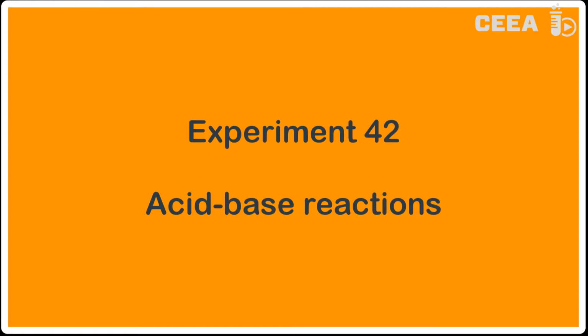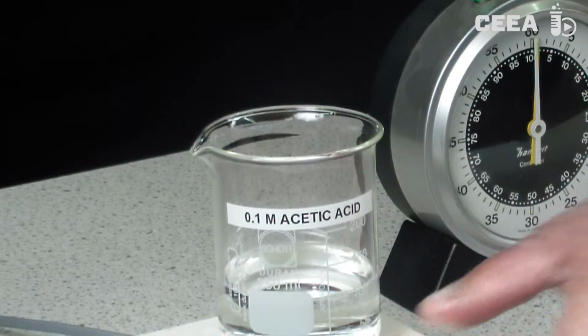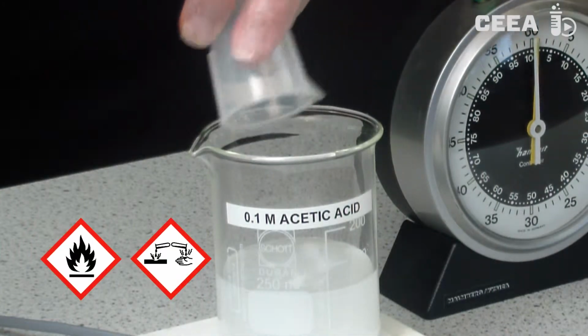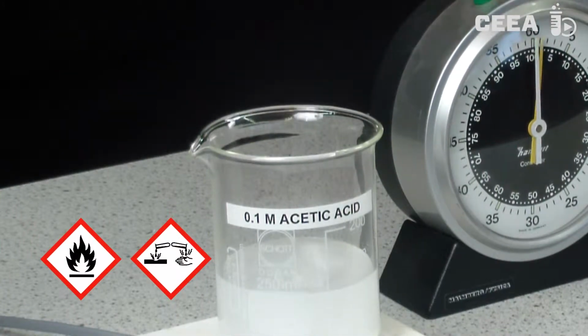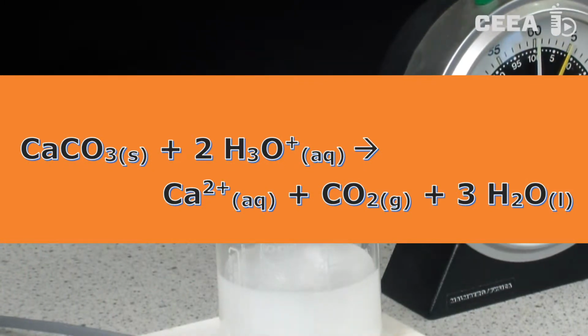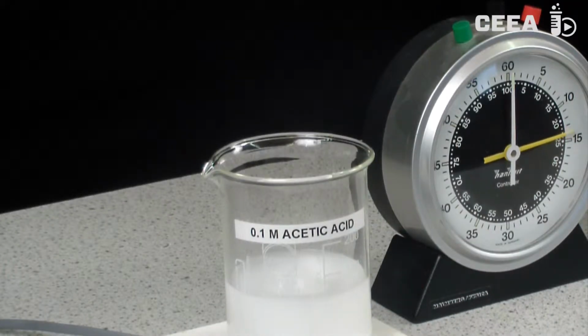Experiment 42, acid-base reactions. In this video we show an example of an acid-base reaction. We add calcium carbonate to an acidic solution and we see a reaction according to the chemical reaction shown here. The result of adding solid calcium carbonate to an acid is that the calcium carbonate disappears. In our daily life we can use this reaction to undo the scaling from a coffee machine.